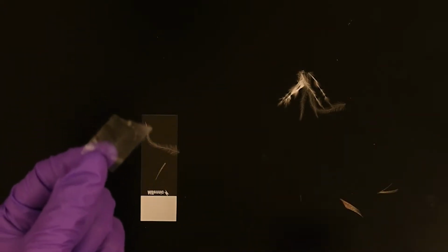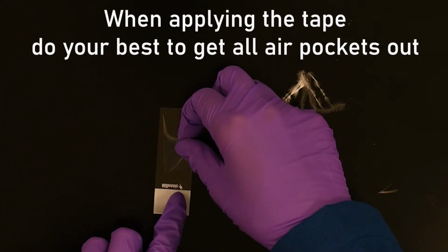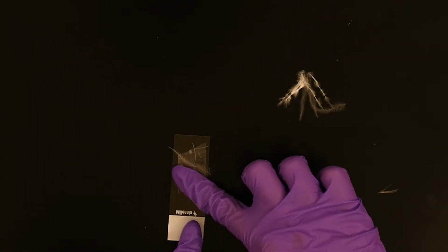Next, you'll take your piece of clear tape and place it over the feathers, making sure to smooth it down so that there are no air bubbles. This will help you get a clearer image and a better picture of those feathers.